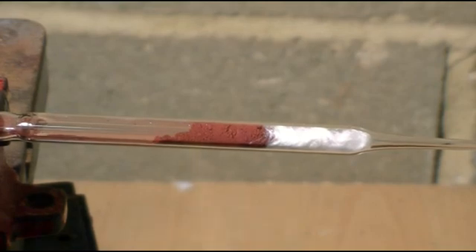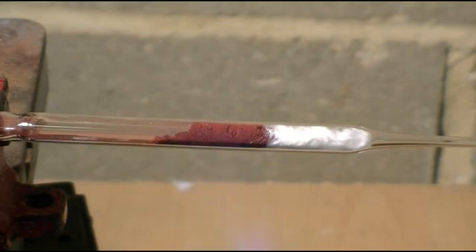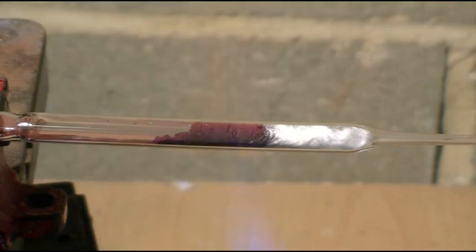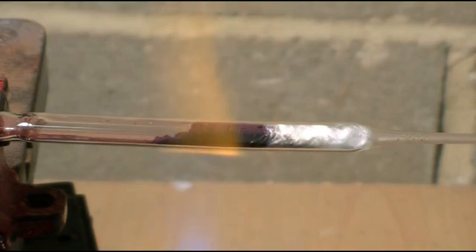Now if we use a gas torch to supply some heat to the reaction, we can see that as we heat our hematite under a flow of hydrogen, it changes from a brick red color to dark black in color. This color change corresponds to a change in the state of the iron.